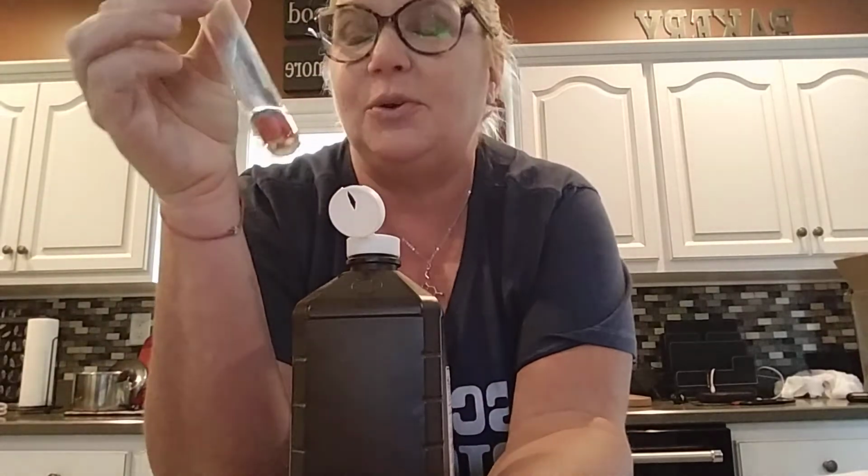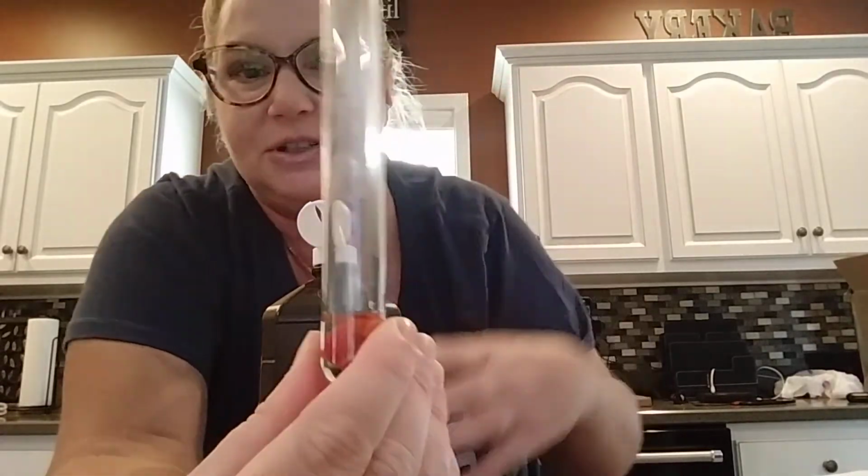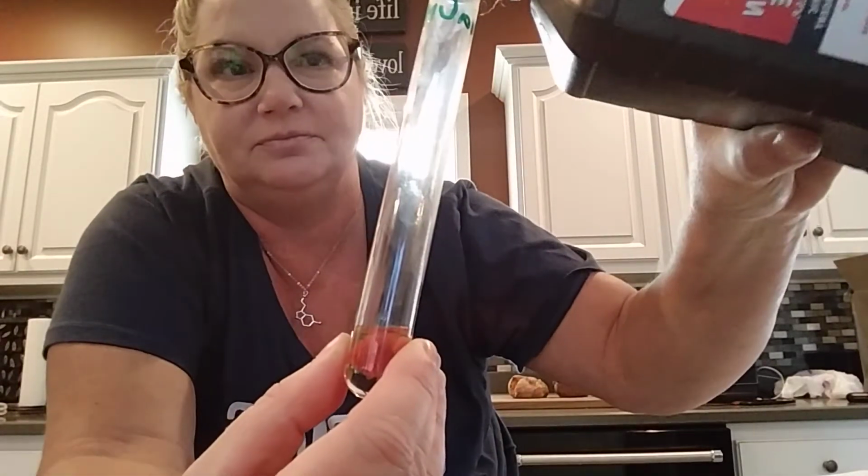This one has been soaking in sodium hydroxide, which makes it a really high pH environment. So this would be when you made your hypothesis as to what a high pH, a basic environment, would do. This would be it.